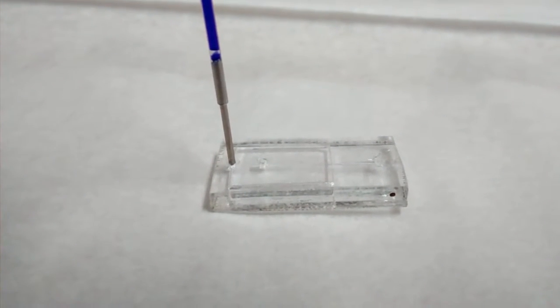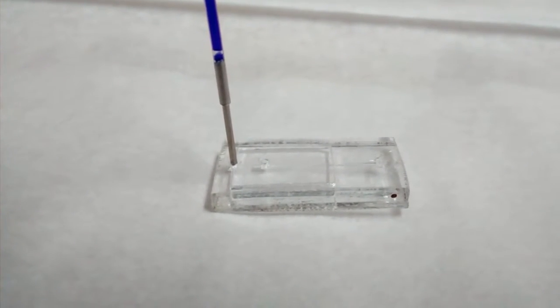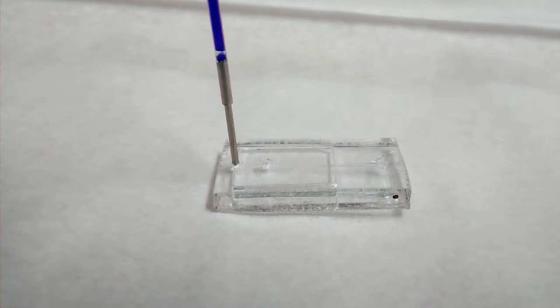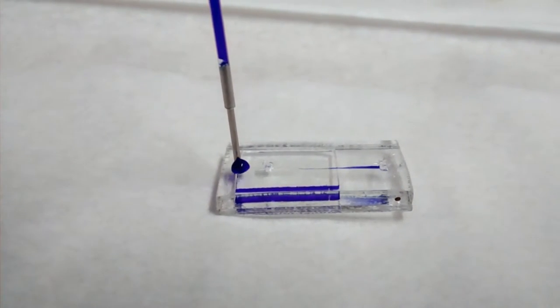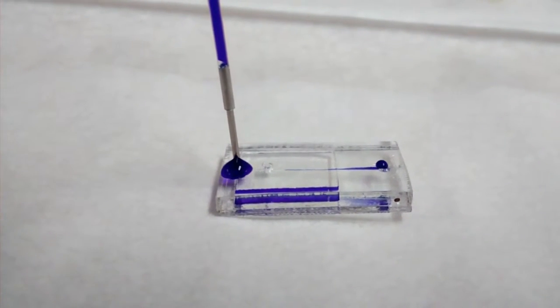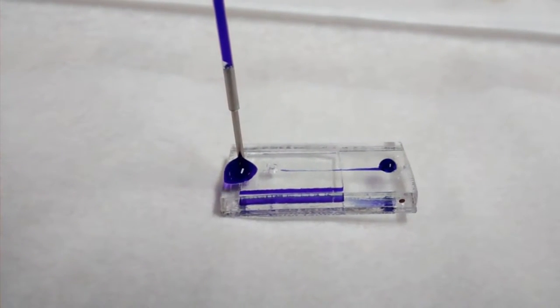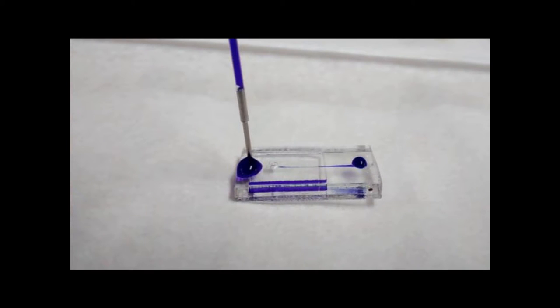I've got a fluid line plumbed up to one of the holes without any glue so you can see it's starting to leak there. But it fills all the way through. We get good sealing. Unfortunately not on one of those branches. Of the four branches one didn't work.